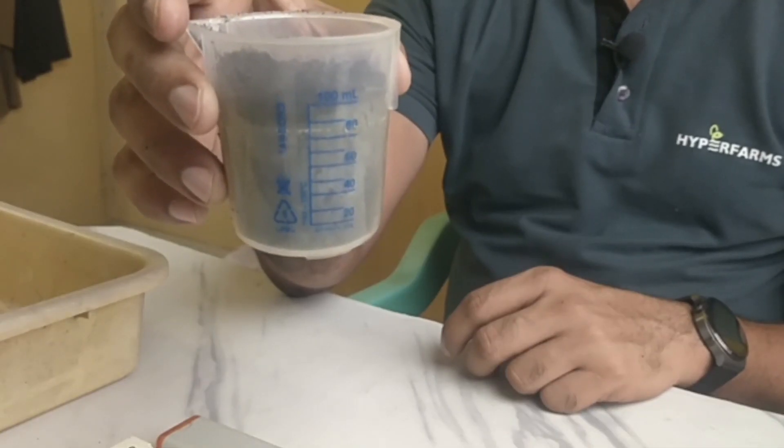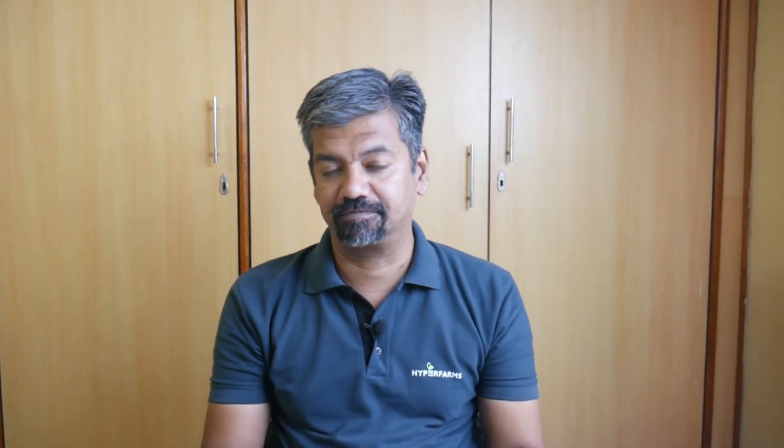We are going to measure the conductivity and pH of a cocopeat sample. For this procedure we need the following things: obviously a cocopeat source — I have a bag of composted cocopeat with me. I have taken a cocopeat sample of about 100 ml in volume, not weight. The method we are going to follow is a 1:2 dilution method — we take one part of cocopeat, mix it with two parts of water, let it settle, then filter the cocopeat particles and measure the parameters of the resulting water.